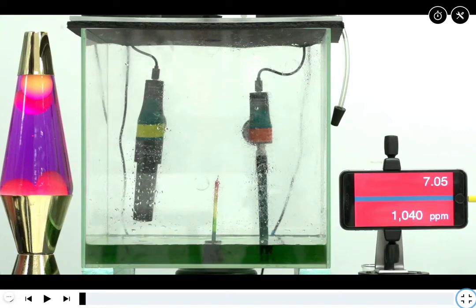All right, in this part of the lab, part 1, what you see here is a tank set up. In the bottom there is water that has a pH indicator solution in it that changes from green to orange as it becomes more acidic. There's also a CO2 probe set in there that measures the carbon dioxide that's in the air within the tank.